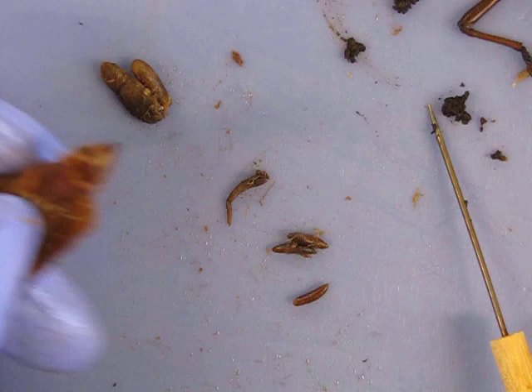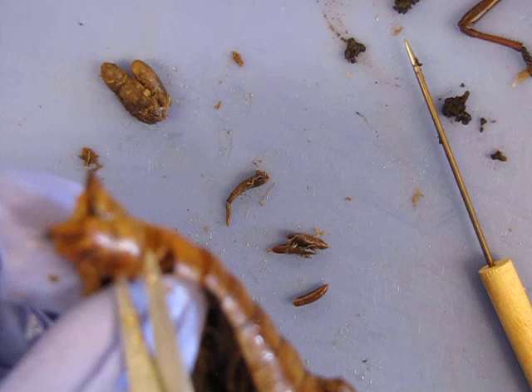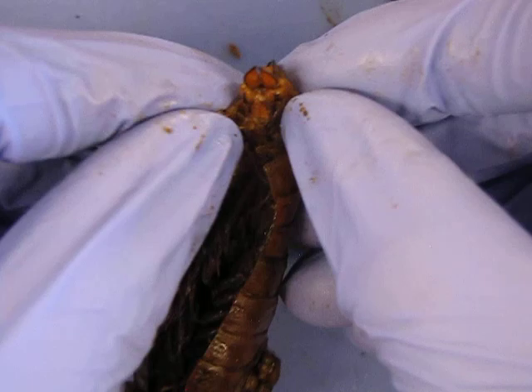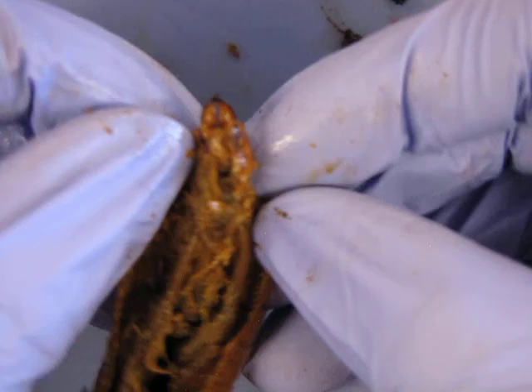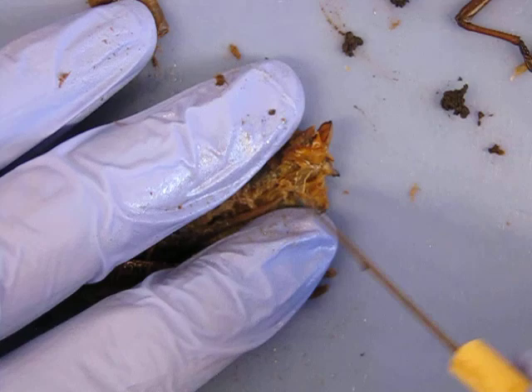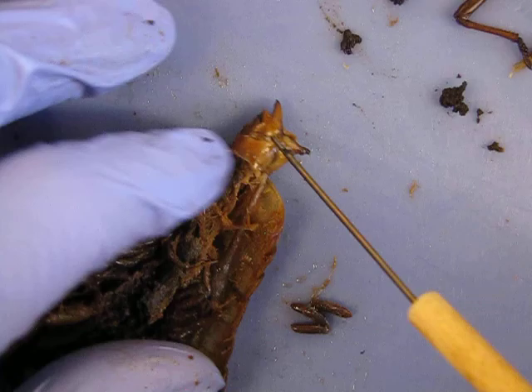Now, as far as the reproductive organs, they're tiny and everything's the same color — that's why nothing ever looks like it does on the sketch. It can be really hard to identify individual things, so make sure you can identify it on the sketch at least. But don't give up; look for stuff and see if you can actually find anything. The best way to try is to leave things intact as long as you can and then trace what you already know. I know that is the oviduct because it comes from the ovary.